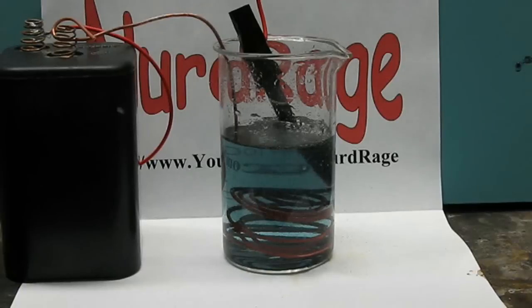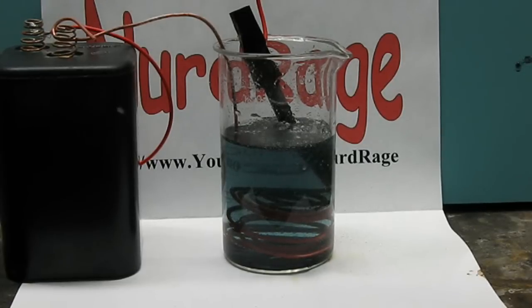I'm using a 6 volt battery. But a better method is if you can use a power supply to adjust the current and find a current level that minimizes erosion of the carbon electrode.